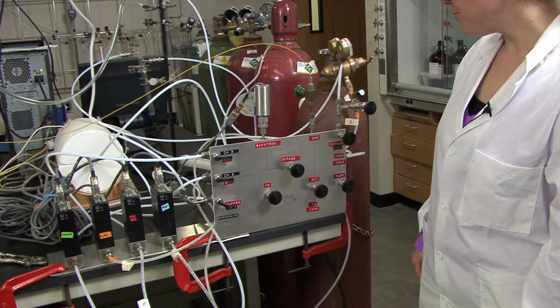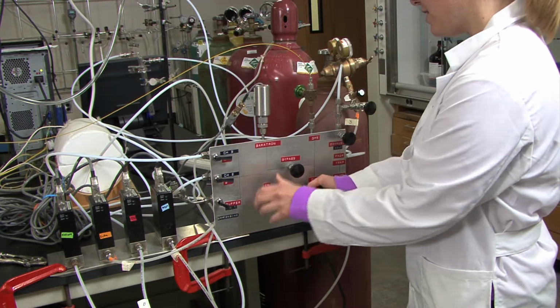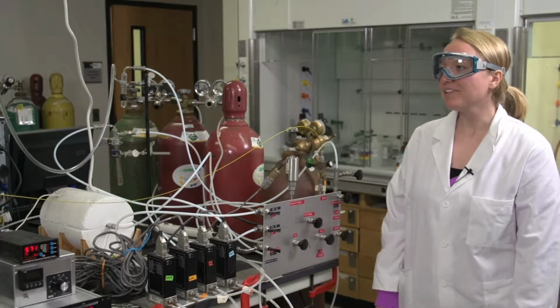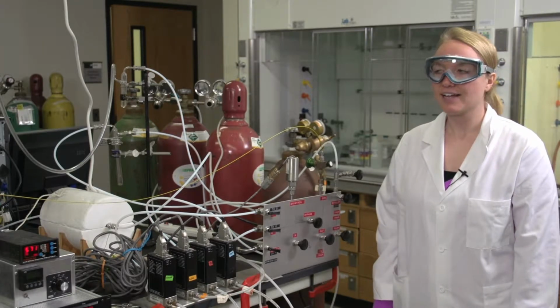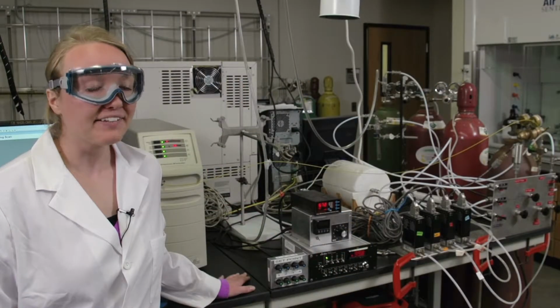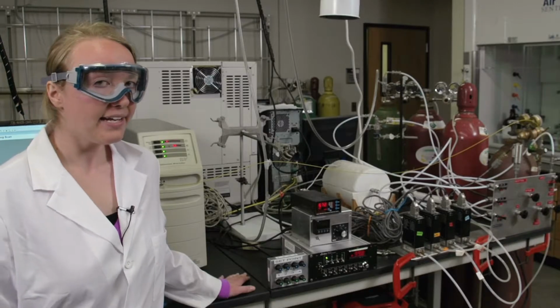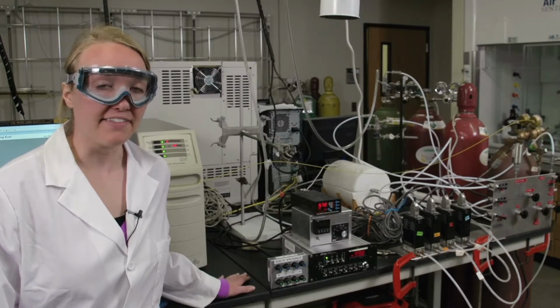And when you're ready to purge the catalyst, you can open the in and out and then close the bypass. So you can go back to the computer, press go, and then wait for the scans to complete so that your carbon dioxide concentration is in the range of e to the negative 9th. After you've saved your argon catalyst purge, you'll need to purge with a mixture of gases. It'll be 80 SCCM of argon, 15 of oxygen, and 5 of ethylene.